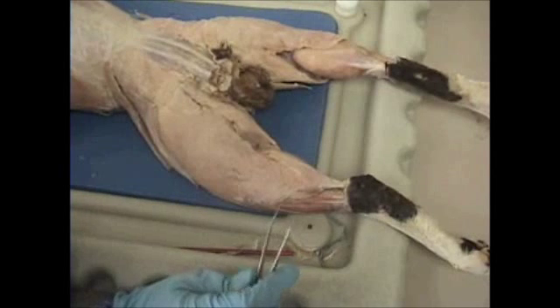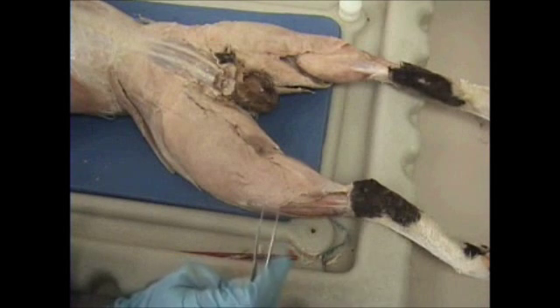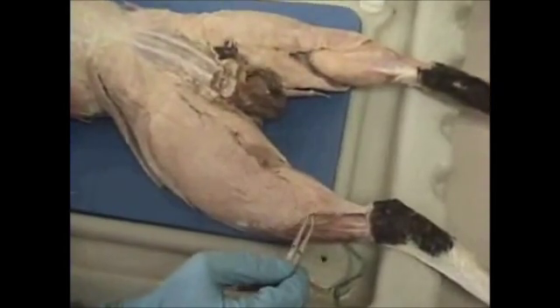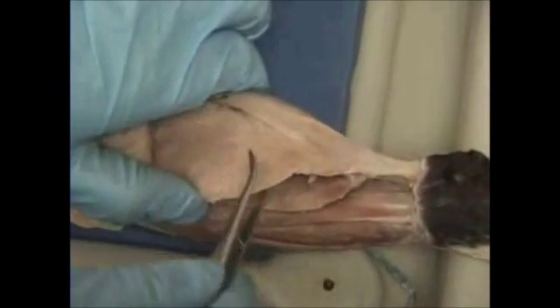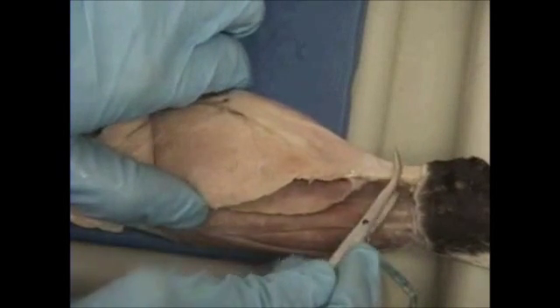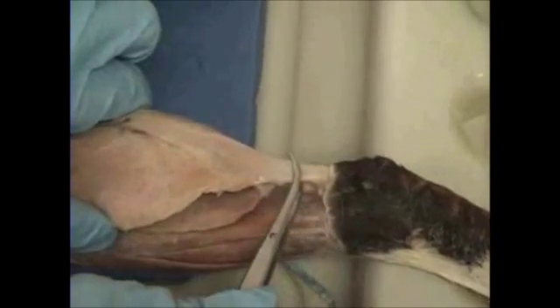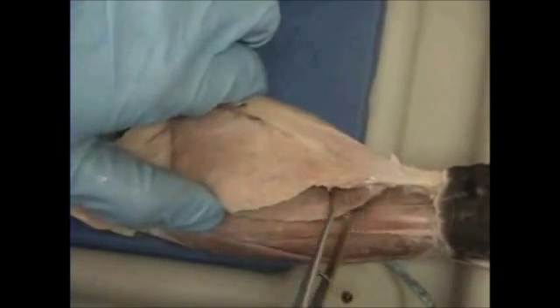Now taking a look at the posterior portion of the cat, also referred to as the dorsal view. Here is the lower extremity or portion of the leg. We have our gastrocnemius, which would be the calf muscle, and soleus. Here, just like the human, the gastrocnemius is connected to your calcaneal bone or heel bone via the calcaneal tendon.